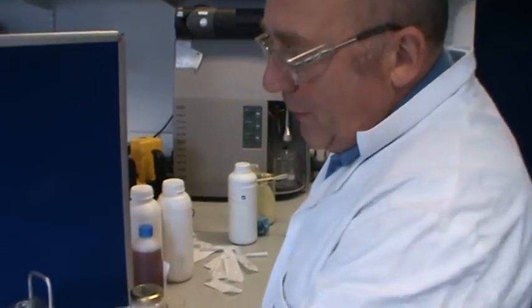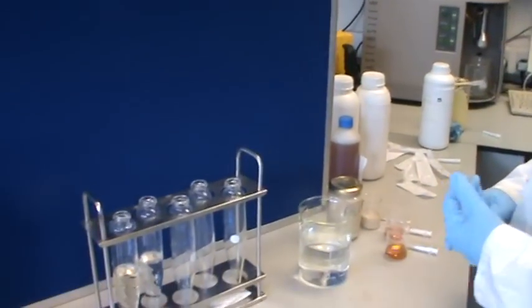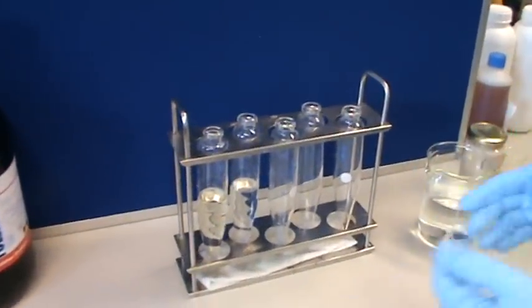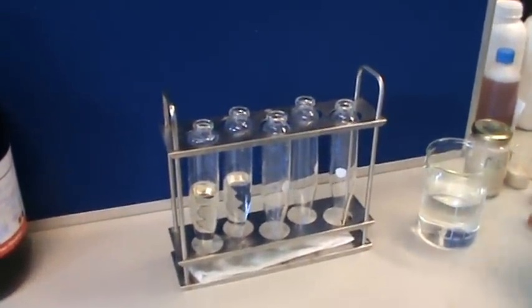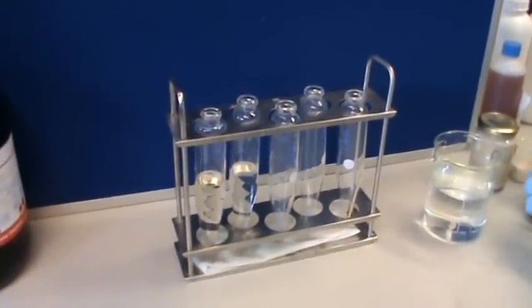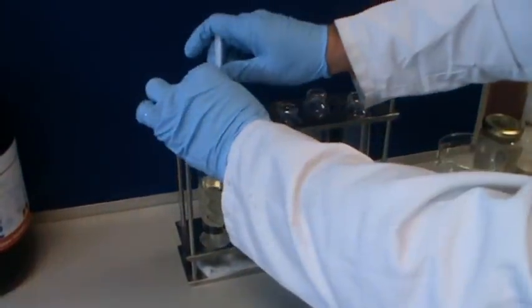Here we've got a tube which contains 50 mils of water. 100 mils is equivalent to your full tank, so we've half filled the tank with water. We then add the phenoxy acid. In this case it's Duplosan, which is a mixture of 2,4-D and what have you, at spray rate.